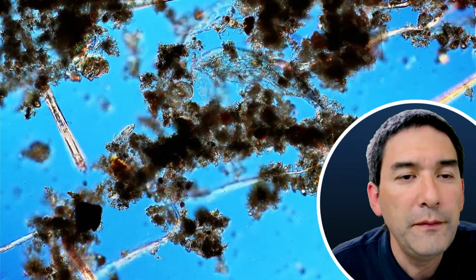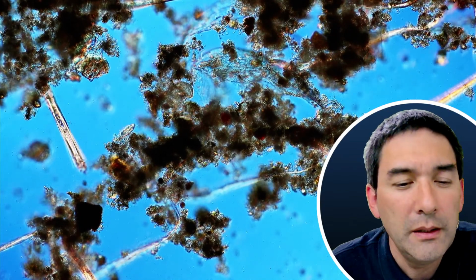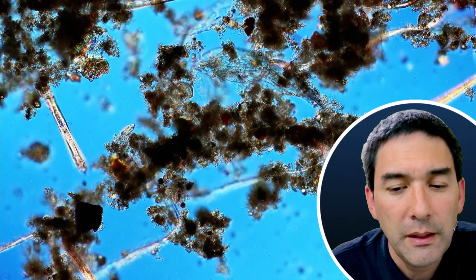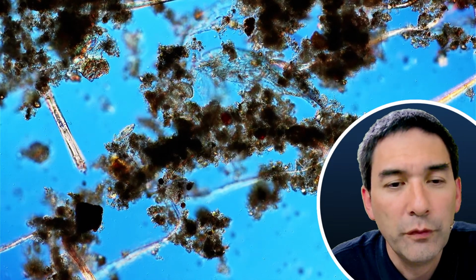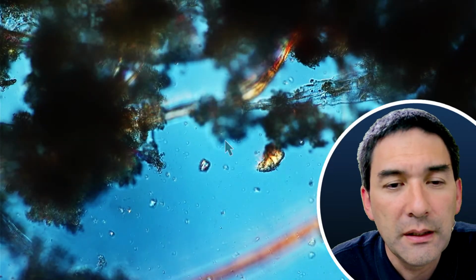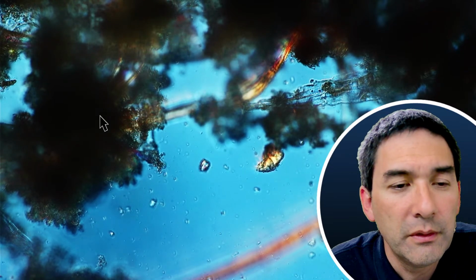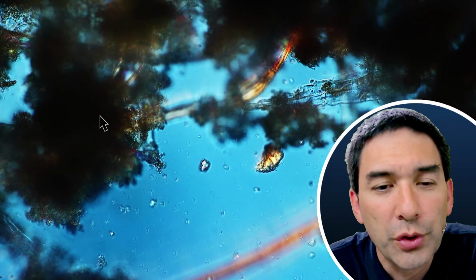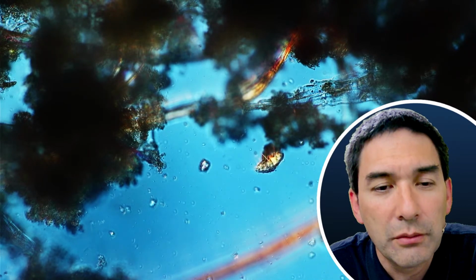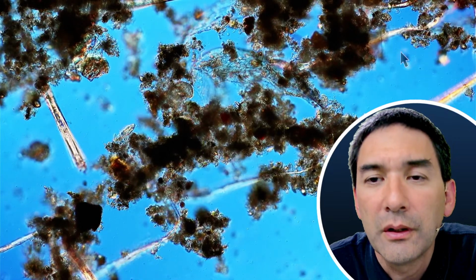Okay, so this is now 15 times faster. A time-lapse video, and you might see, not a lot of movement really. And this is indeed an indicator that there is not much movement going on, because usually there is a little bit of movement here in the corner, and I've zoomed in here. What you're able to see is the tiny particles moving back and forth, but that's Brownian motion. Sometimes there are bacteria connected to larger sand grains, and this causes the sand grain to move. For example, this here in the top corner.